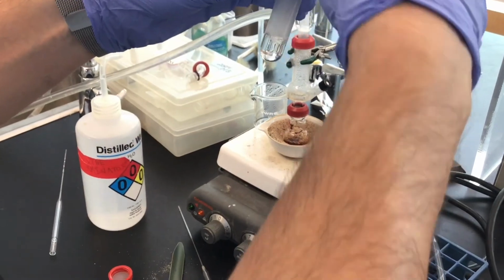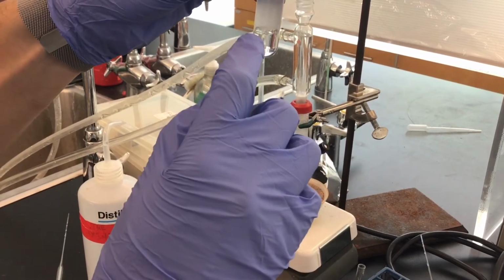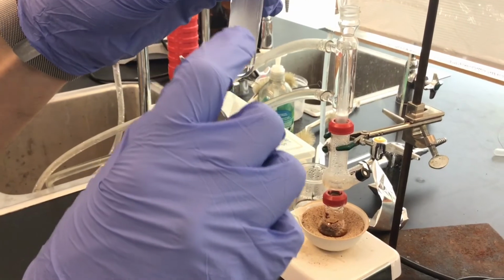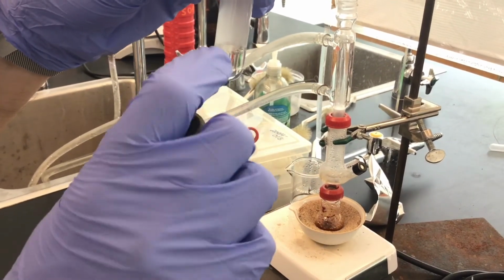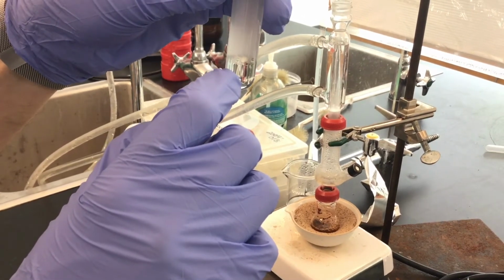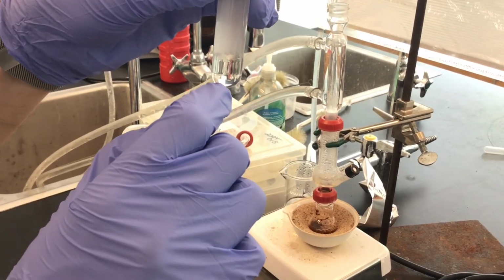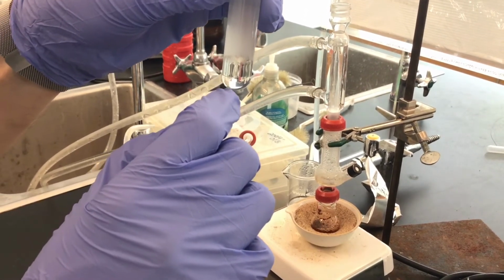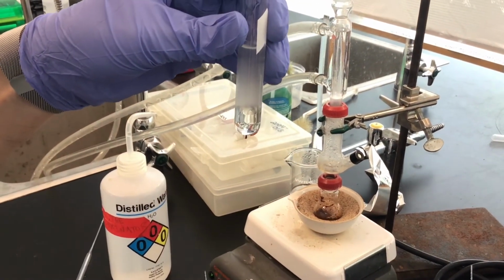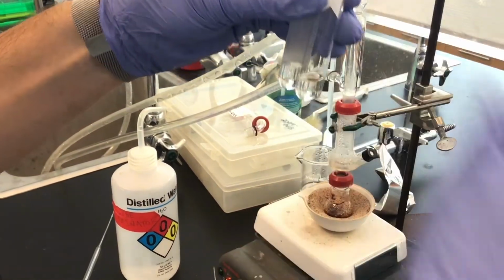And I wait for the two phases to separate. Sometimes you can see, if you ended up shaking it too hard, right in between the lower and upper phase is the interphase. And sometimes you can create an emulsion, and that is very difficult to deal with, because then it's hard to differentiate between the organic and aqueous layer. And if you make an emulsion, then it won't separate at all. And there are tricks to solving that issue, but I'm not going to create it for you.